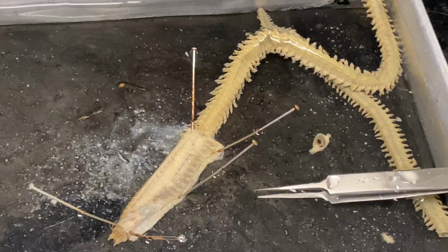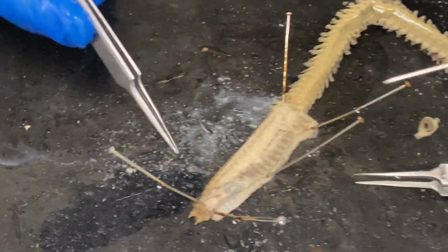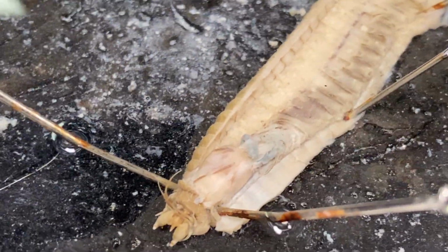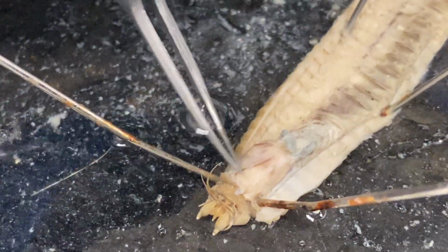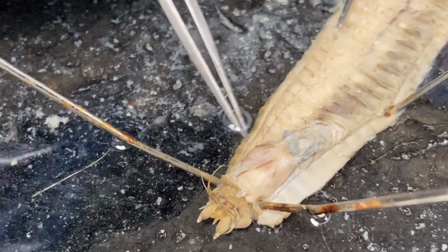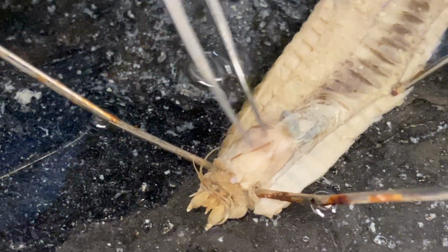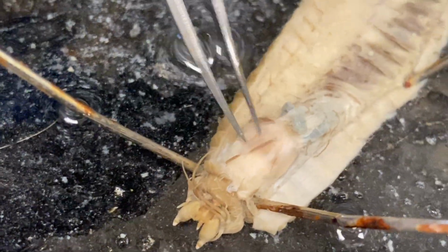Most of the internal anatomy on the polychaete is going to be towards the anterior region. Once you get past that, everything is just iterated along the entire body, and it's pretty similar. So we're going to focus at the anterior region. Again, what we saw earlier was the mouth leading into that muscular pharynx. That is this right here, this bulbous bit is the muscular pharynx. You can see these pharyngeal retractor muscles here. They're kind of thread-like.